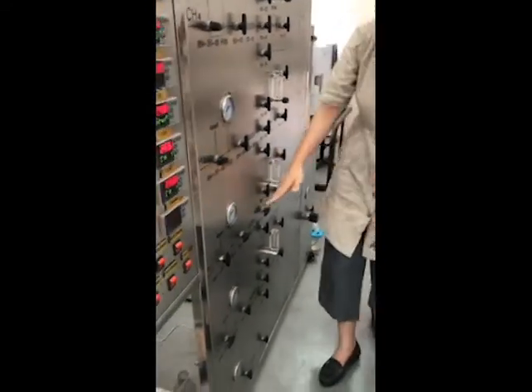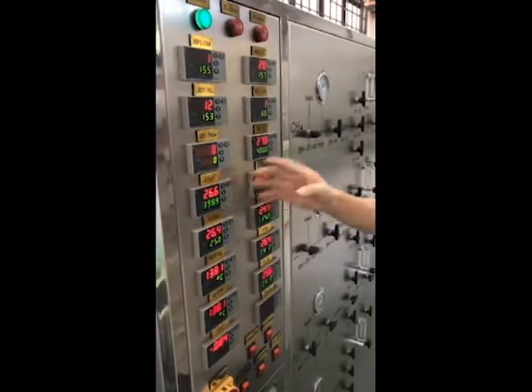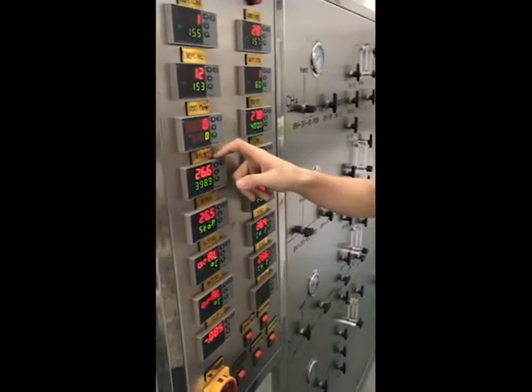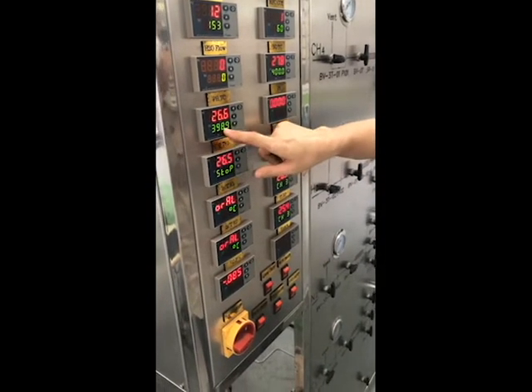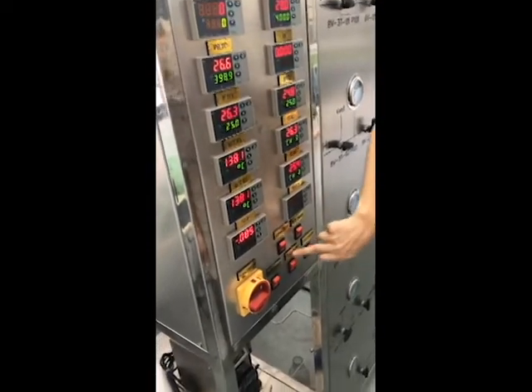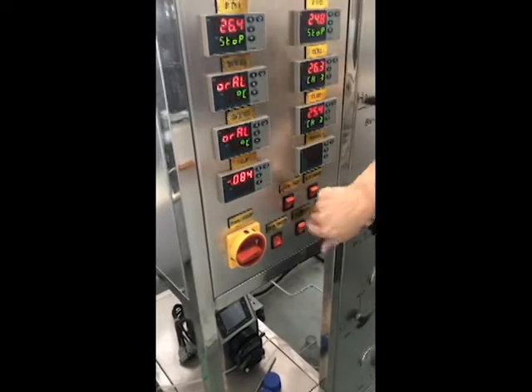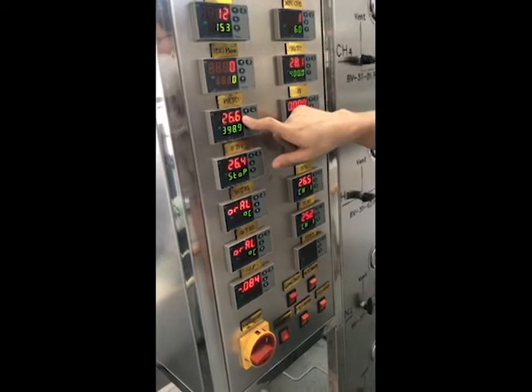And when the gas is set properly, you can start to set the temperature. When you are doing dry reforming, there are two temperatures that need to be set. One is the preheat. Setting 390 is enough, but you need to turn it on, then it will heat. Turn on the preheat temperature control, then your preheat will start to work. You can see the temperature start to rise.